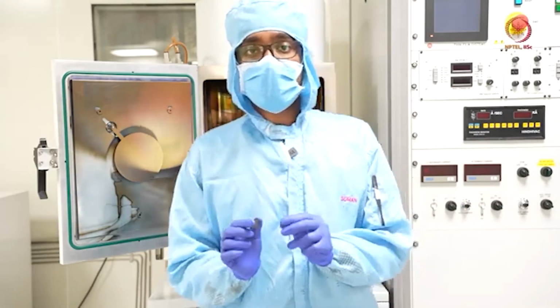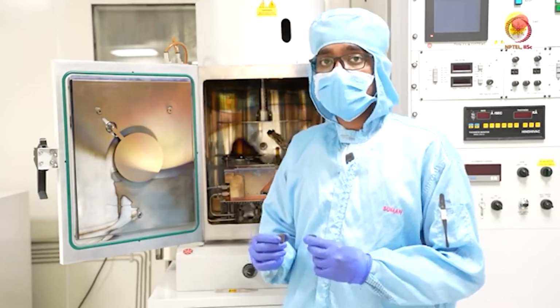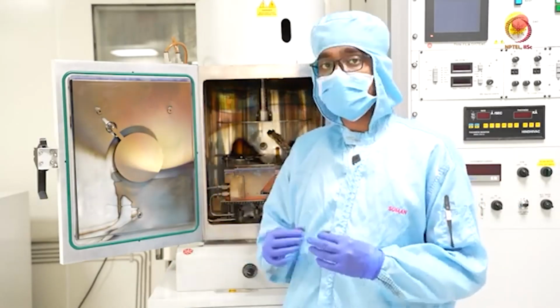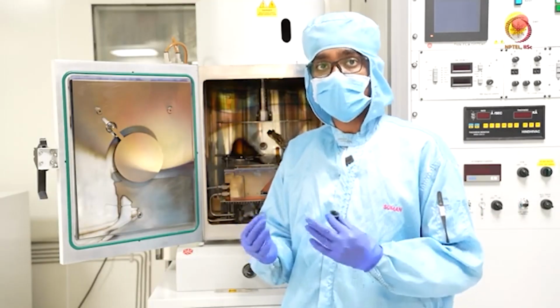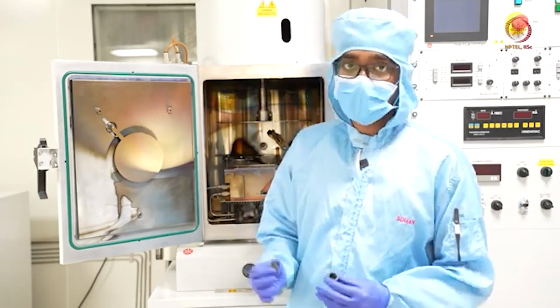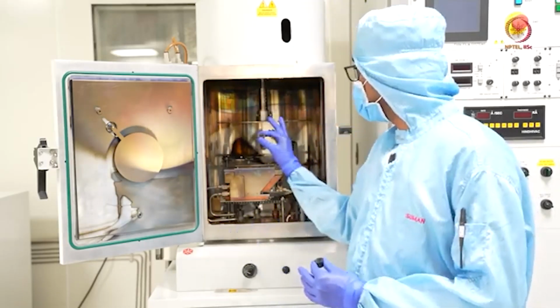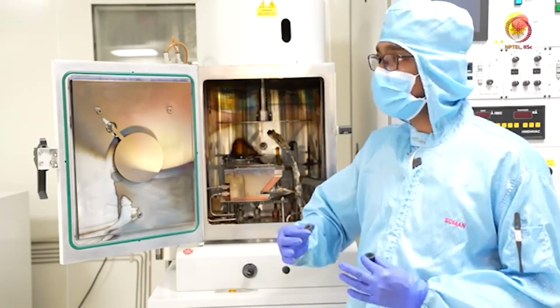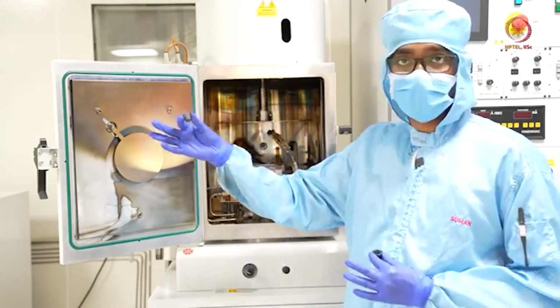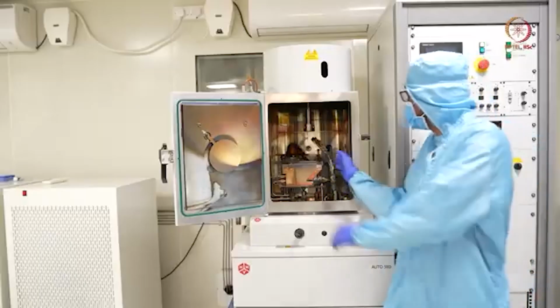As you have already seen after one deposition how it looked like, when the vacuum creation is happening, I will show you the raw materials as well, how they look. Okay, so now let us take this chuck out and we will show how to load the things. We will prefer to load these things in a solvent bench, so we will go there and show you. So let us take it out.